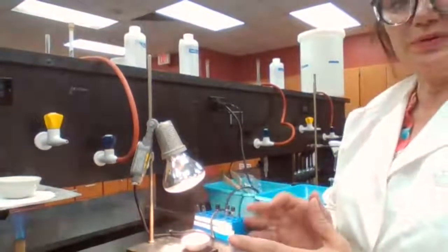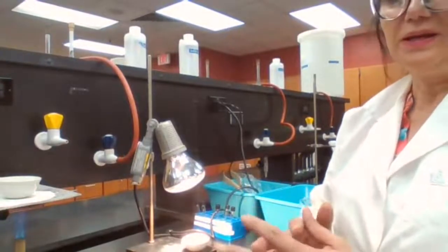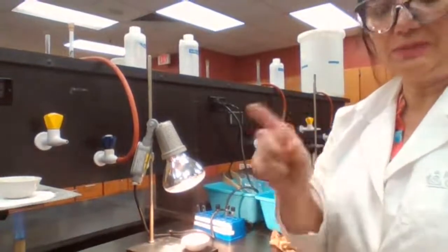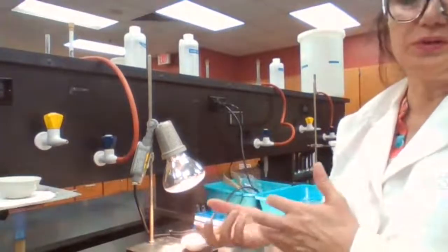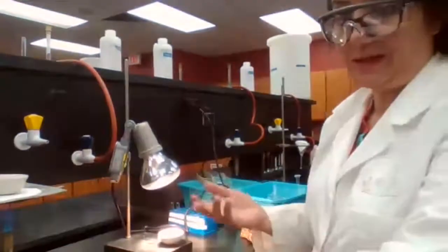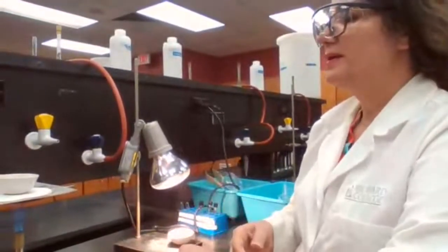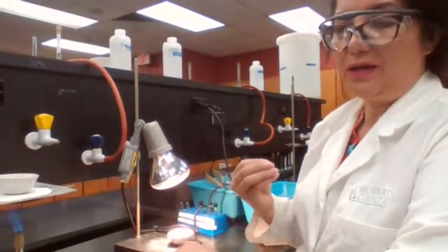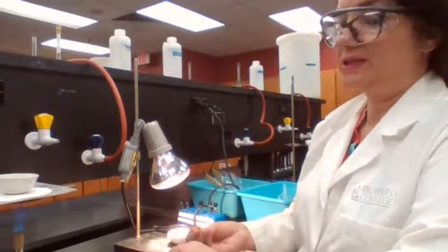Some range of percent error is acceptable in an experiment. That acceptable range depends on what type of experiment we are doing, and whether, for example, the chemical reaction reaches equilibrium or not. It also depends on human error, caused by the person performing the experiment.